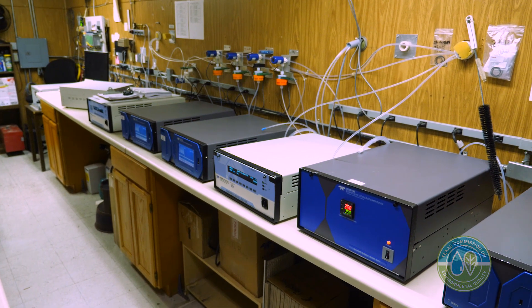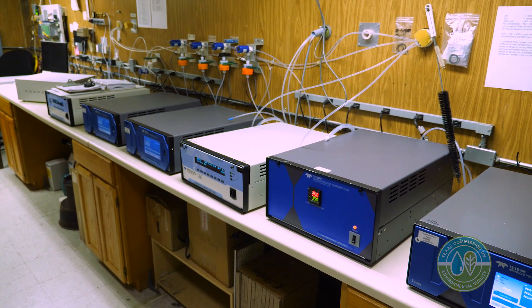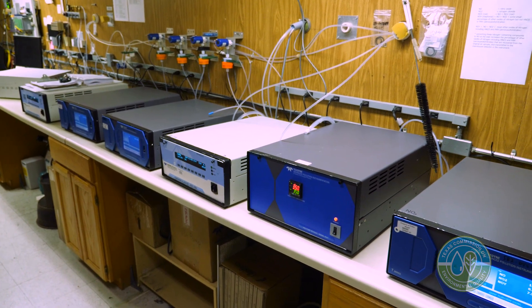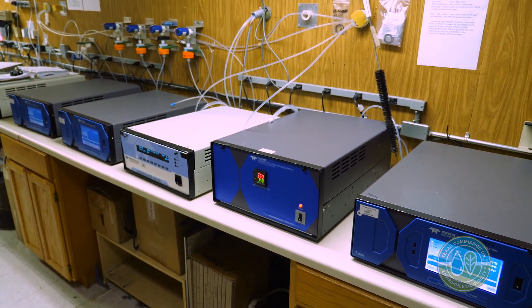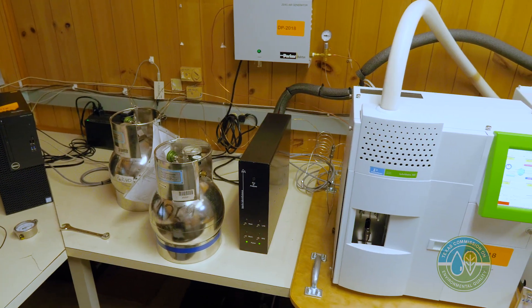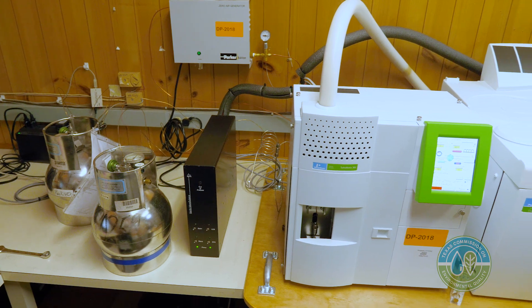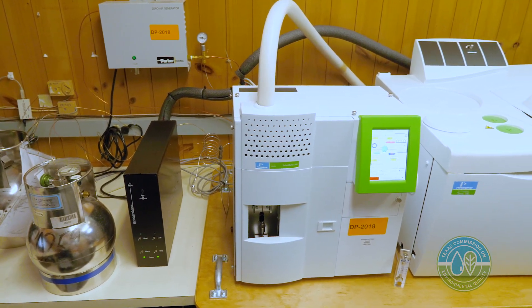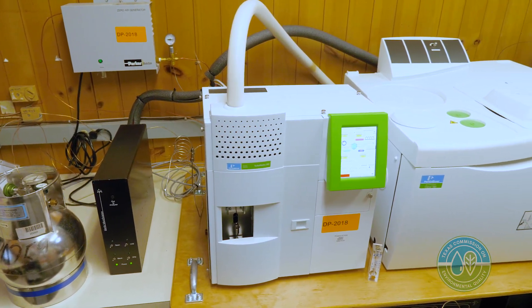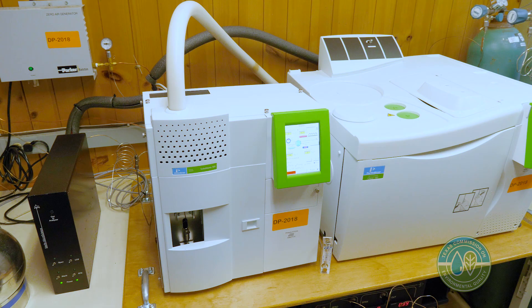If the site has a trailer and you walk inside, then there are some instruments that you'll see on the inside also. We have non-continuous and continuous volatile organic compound samplers — those are the canister sampler and the automated gas chromatograph.